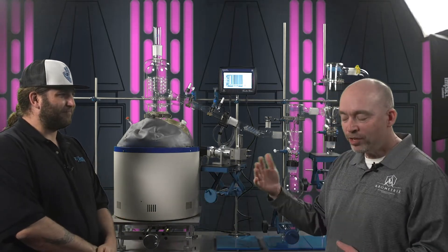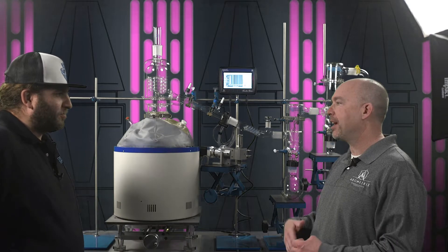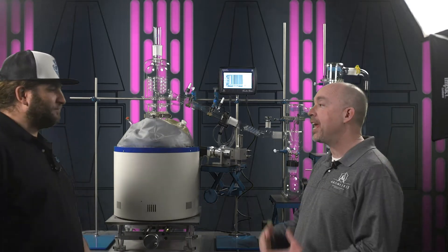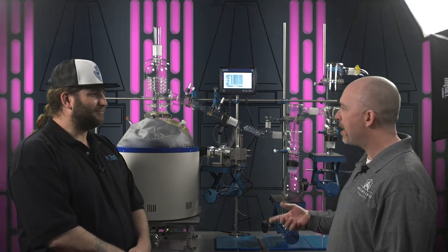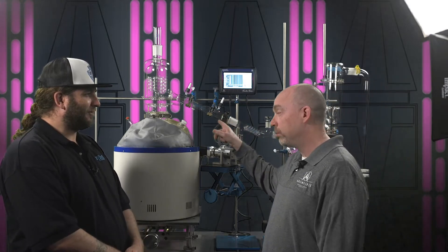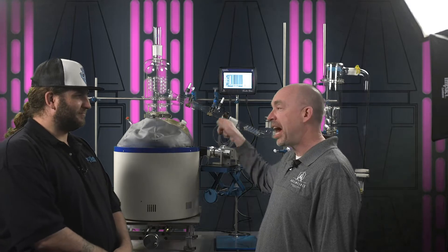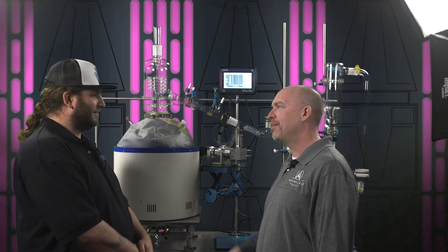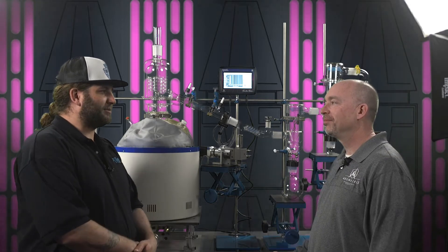So we had just finished that project for that controller — the BBC one, right? It worked great and we were high-fiving, happy happy joy joy, thinking hey, what else can we do together? And you came up to one of your short path systems and said, you know, if you shine UV light on here like a black light I see green — what can you do with that? We saw something, we didn't know what we were seeing, what light we really use, and that got the whole process thinking.